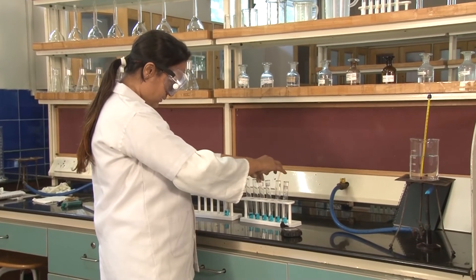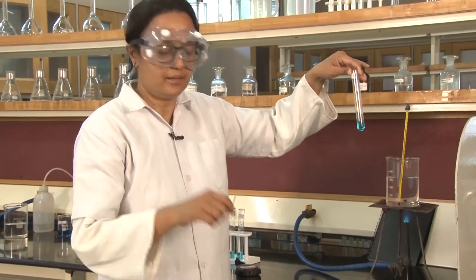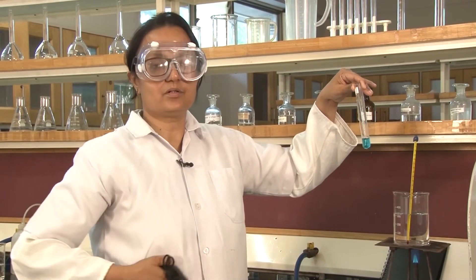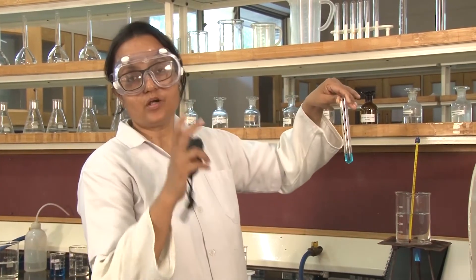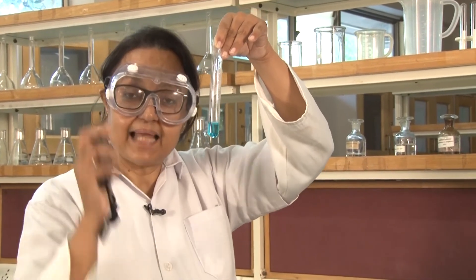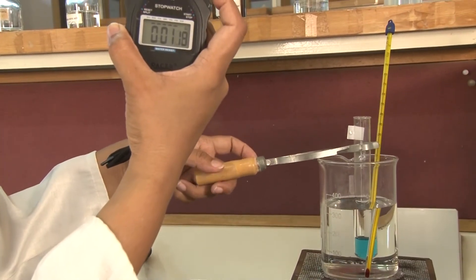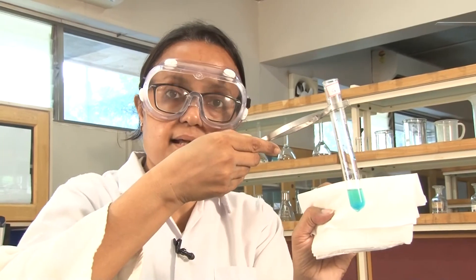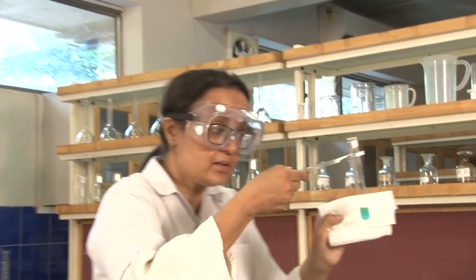Every time you take another sample, wash the syringe with water so no residue of the previous solution remains. Starting with G, the moment you put the test tube in, press the stopwatch. Keep a watch on the color change — the moment you see a change in color, note that exact time. The temperature is 80°C, which is the ideal temperature for the Benedict's test.